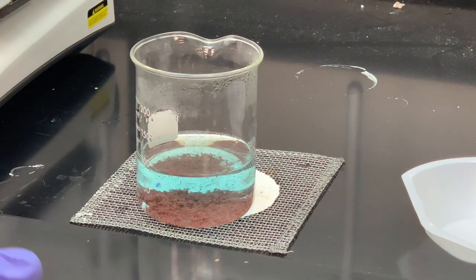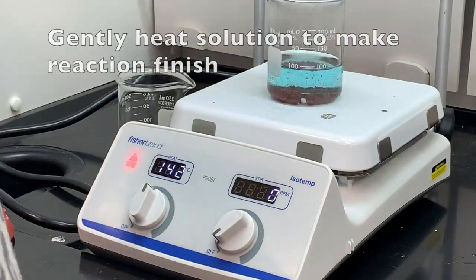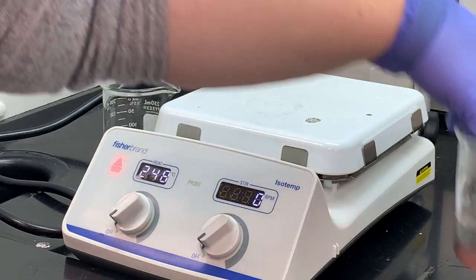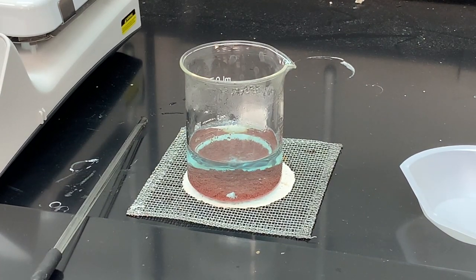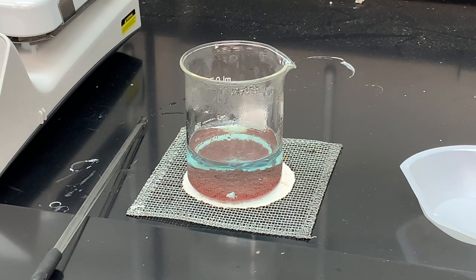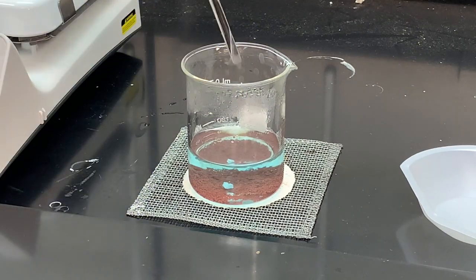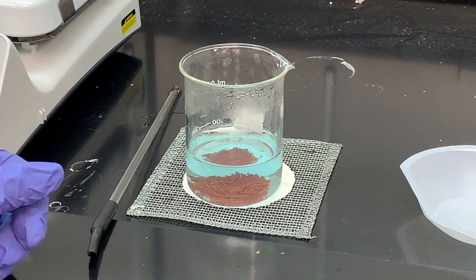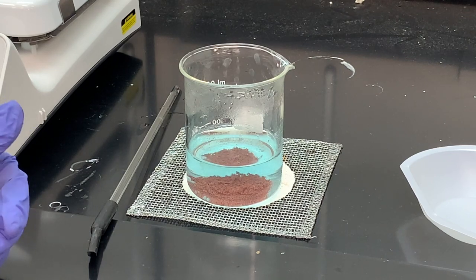In my experience I haven't had a lot of success using the hot plate to get this reaction to go, but it is in the procedure, so we'll do that. I think the reaction has gone as much as it's going to, so I'm taking it off the heat. You can decide here: do we still have that blue coloring in the solution — what is that evidence of? Do we still have zinc? It looks like there is definitely still a blue tint to that solution, which should help you decide the limiting reactant. Remember, we're looking at the reaction between copper sulfate and zinc specifically.